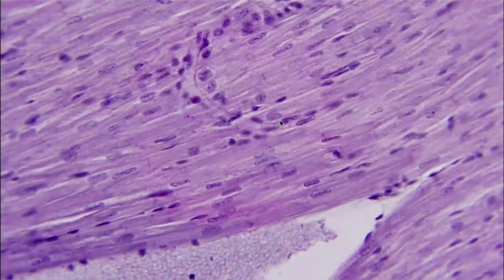Next, we're going to have cardiac muscle. Now, this one can sometimes get confused with skeletal muscle, but we're going to go through a couple ways you can tell the difference. So first of all, we're going to notice that there's lots of nuclei in here, right? We see lots and lots of cells, but we also see amongst the striations, or these little lines right here, right? We can see these are all striated, lots of little lines, especially down here, the lines are quite pronounced.